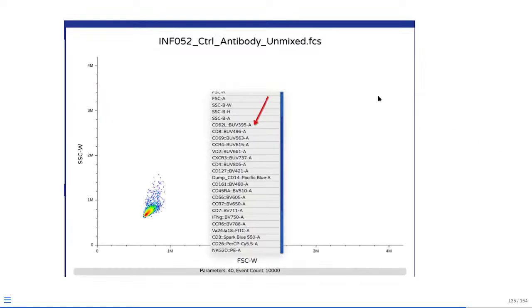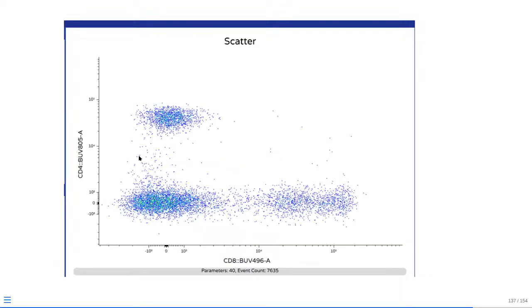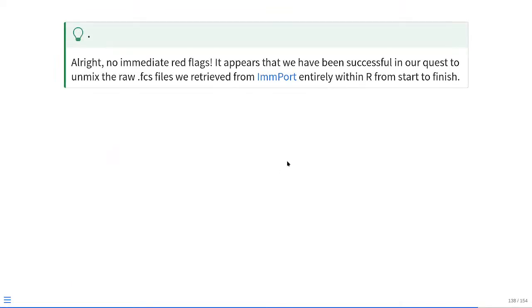So at that point, as I load it into Floreada.io, I'm looking at the little drop-down menu. All my markers and antigens look to be correct, so that's one check in our favor. As I go and look at forward scatter by side scatter, they are still there, so that looks good. And then if I look at the individual fluors on the two-dimensional axis and put on a logicle or a bi-exponential transformation, this looks reasonable enough considering we haven't actually checked the signature matrix. So to all outward appearances, it looks like our FCS file is properly unmixed as far as the formatting goes. So no immediate red flags.